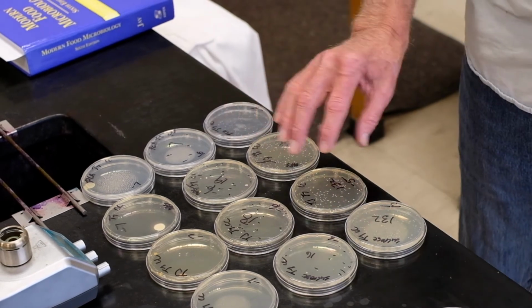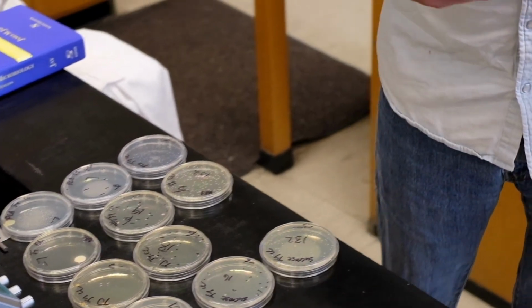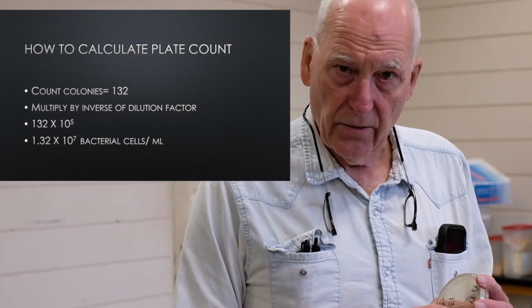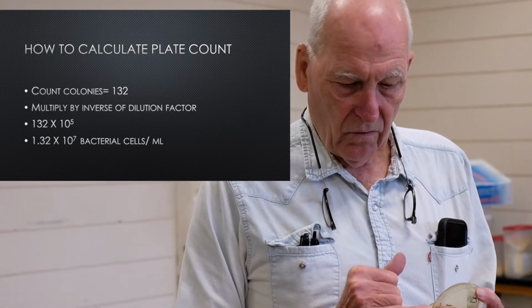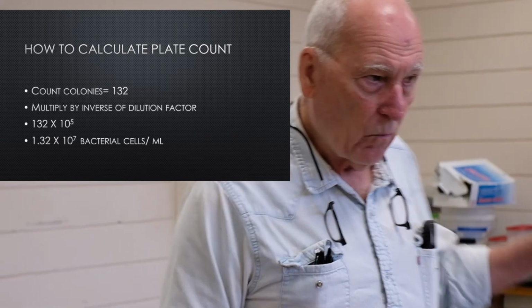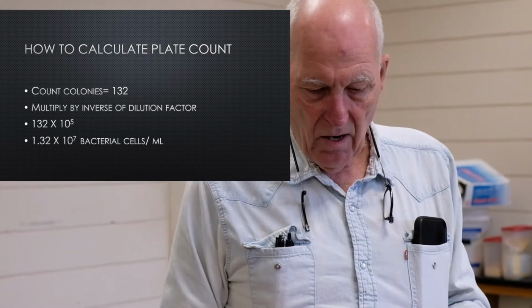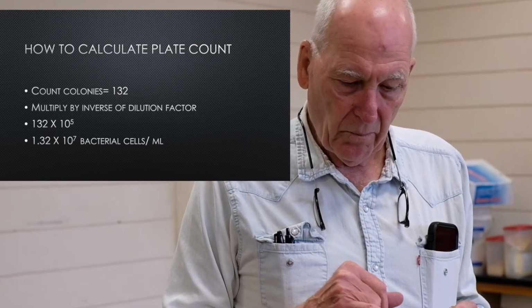Now another thing I want to look at, I'm going to work you backwards to find out what is the number. By counting, we have 132. It's at a -5 dilution. So the way we're going to convert that to find out what's in the fermentation chamber, we're going to invert the dilution so that it becomes a +5.